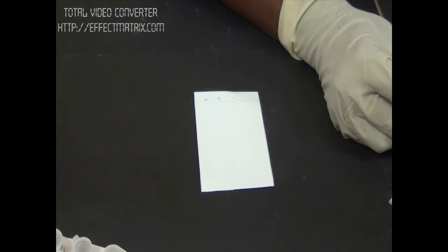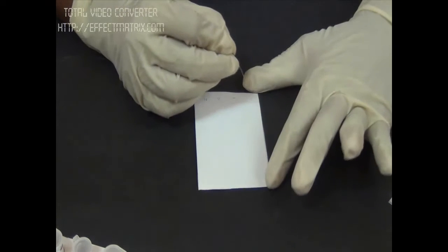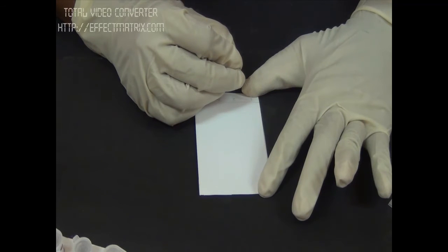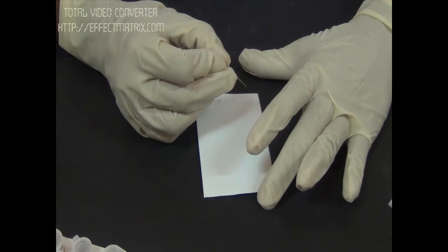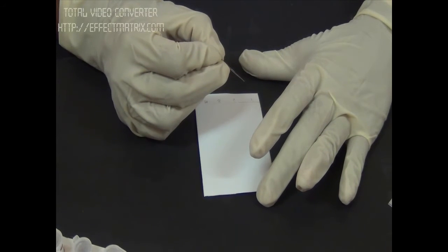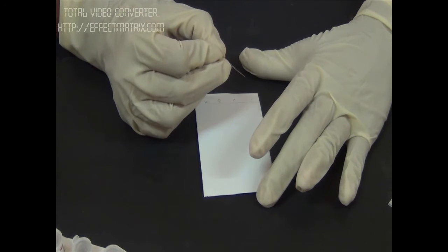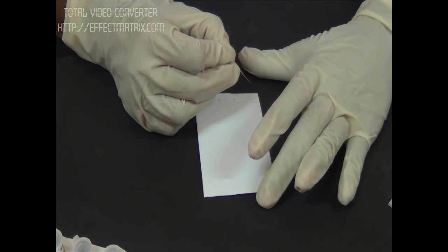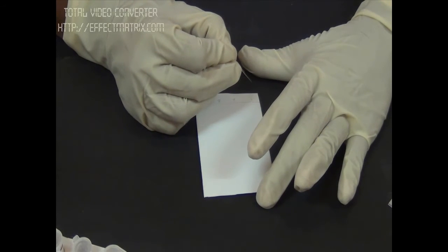For loading the sample, we will use a capillary tube. We will take an amino acid with a capillary tube and load the plate. We will load all four samples one by one. Once we add a drop of sample onto the plate, allow them to dry before adding another spot.